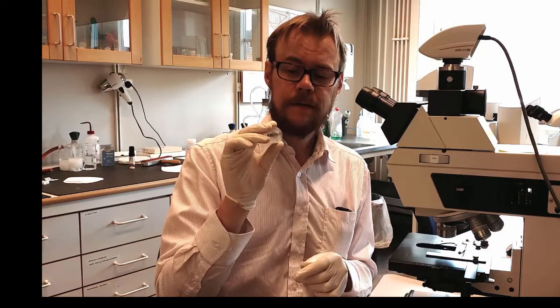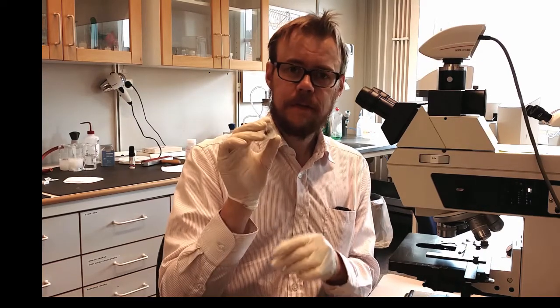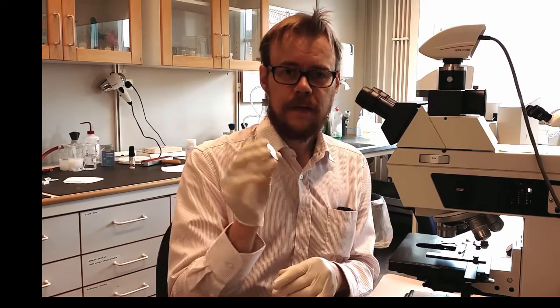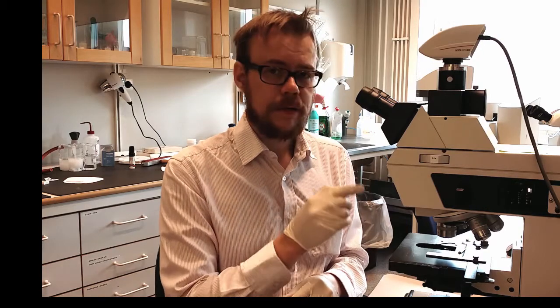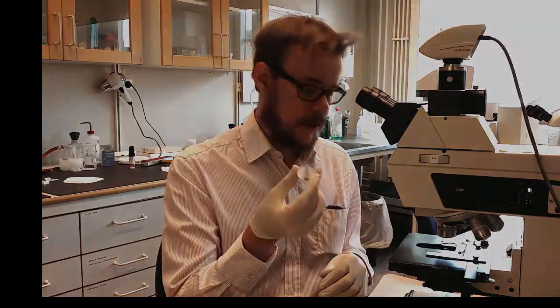We have now come to the final stage where we're going to do the one micrometer polishing. That's when it becomes mirror-like, and to see the effect of that, we need a better microscope. So here I use a more advanced microscope to see the details of it.